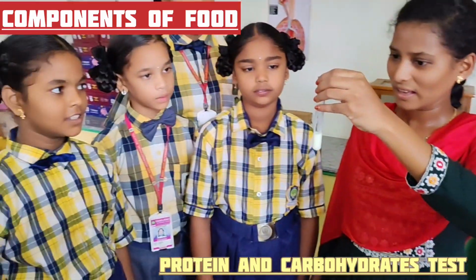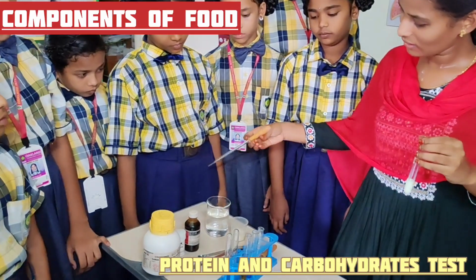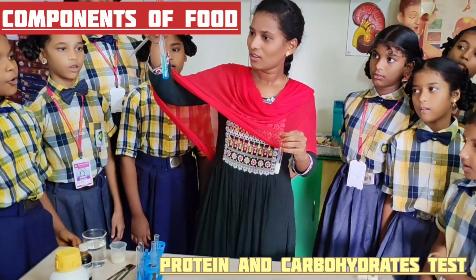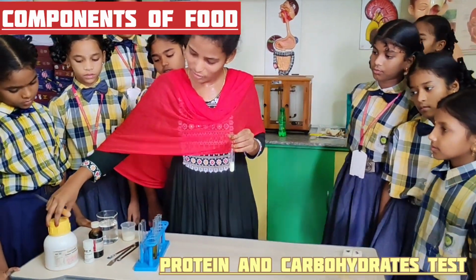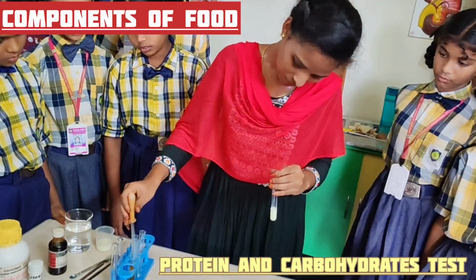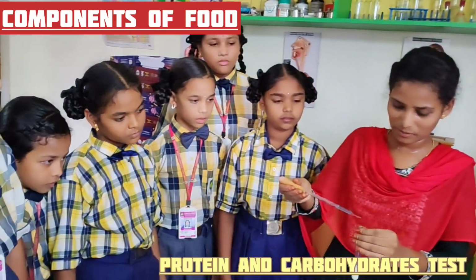Observe. Now I am adding copper sulfate and sodium hydroxide solution into it. This is sodium hydroxide solution and this is copper sulfate solution. We already prepared them with the crystals of sodium hydroxide pellets and copper sulfate pellets. We have to add 2-3 drops of copper sulfate solution into the milk. Okay? Observe.